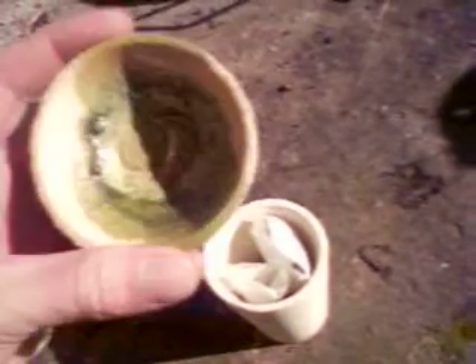And I am probably going to go ahead and reuse this scorification dish right here — it is not going to hurt. We don't care if we add a little more gold to the lead. Since this is used for removing impurities, it is not going to matter that there is copper in here. The copper will just get mixed into the litharge and get slagged off. It is not going to hurt at all. Here is another one that I had used on a copper ore — it has all kinds of green in it from the copper.